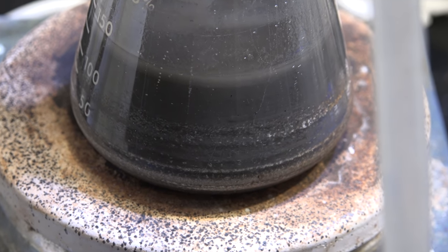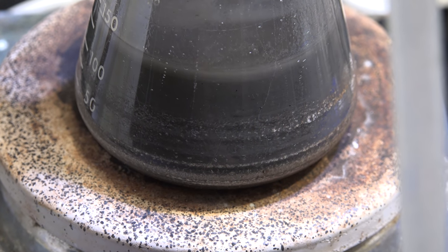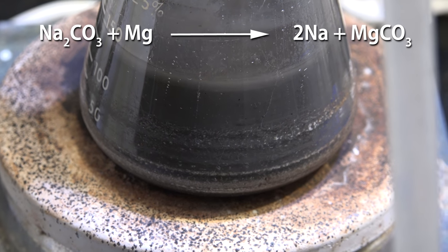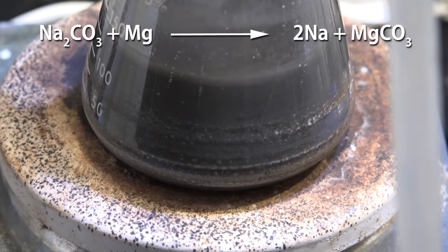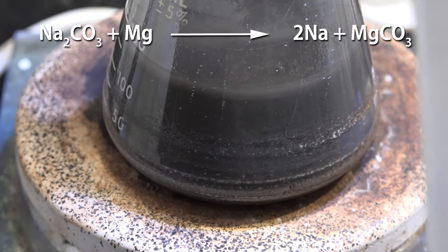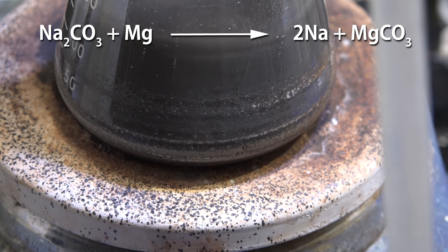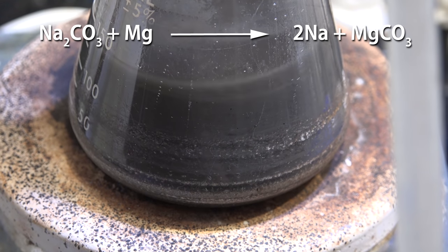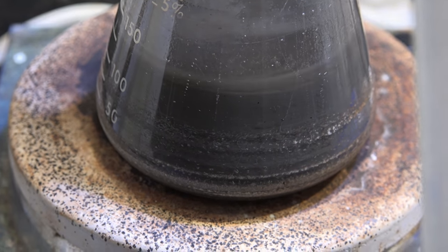Second, I tried to revisit making sodium with sodium carbonate rather than sodium hydroxide. Without hydrogen, it might be a more efficient way to make sodium as you would only need half the magnesium. I tried this once before, very early in our project, but that was using our older catalysts. Perhaps our newer, more advanced catalysts like menthol or borneol would work. Unfortunately, they did not, and I got no sodium production.